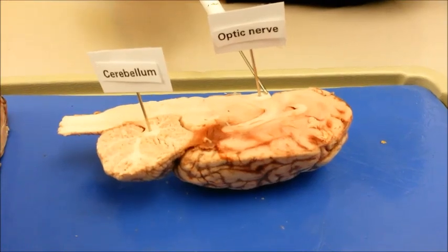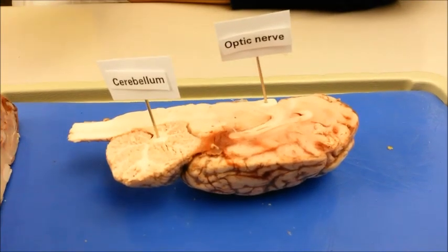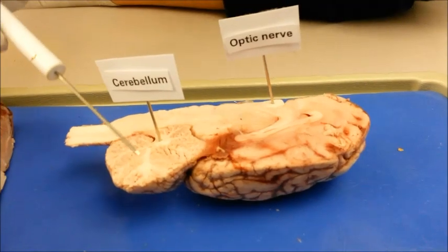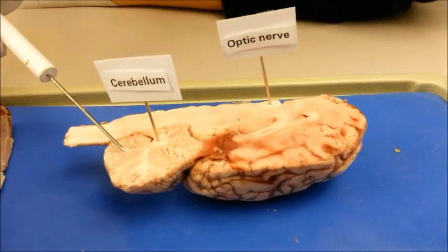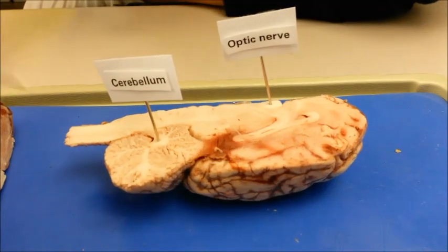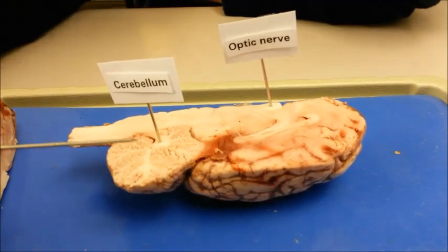Although not present, the optic nerve connects the eye to the brain, providing the ability to see. Gray matter is the area of the brain and spinal cord containing cell bodies, dendrites, and un-myelinated axons. Its main function is to send stimulants to the central nervous system in order to create responses.